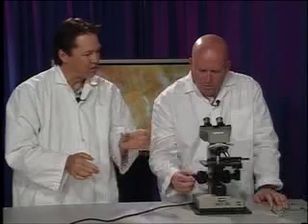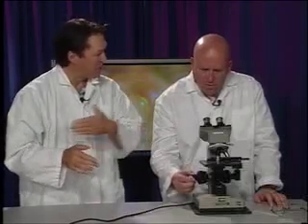Oh, and you're able to actually focus on a single cell layer here. And if you start to change the fine focus, you may focus on this level, or this level, or this level. And because of that, you may see different levels of organisms or different cell layers. I see. So you're going to constantly notice that you're going to have to be fine focusing your specimen. Yeah. Because the mechanical stage adjustment is on the left-hand side, I would get into the habit of fine focusing with your right hand so that your left hand is freed up to move the specimen up and down and back and forth over here.